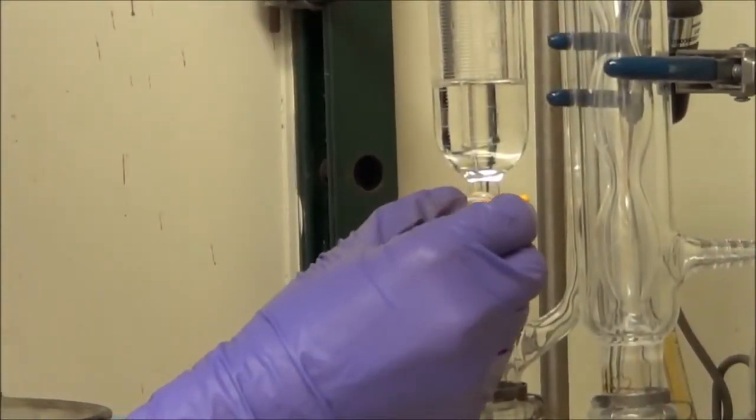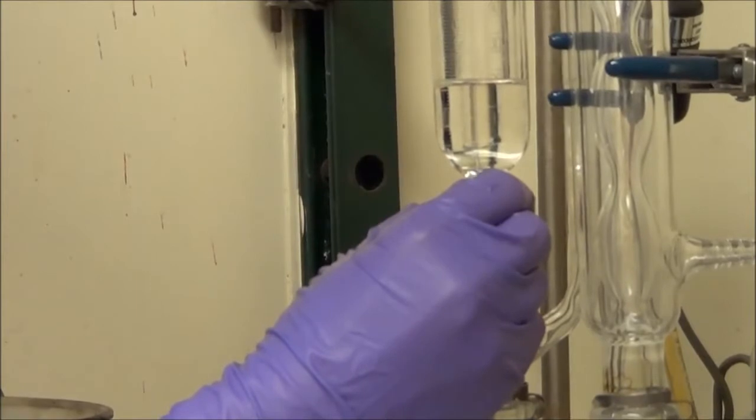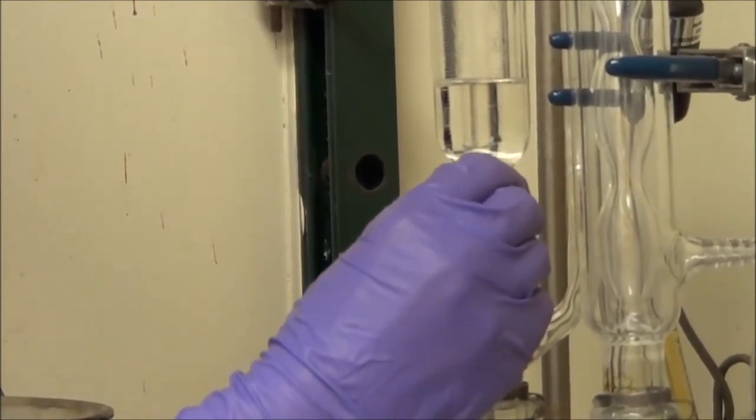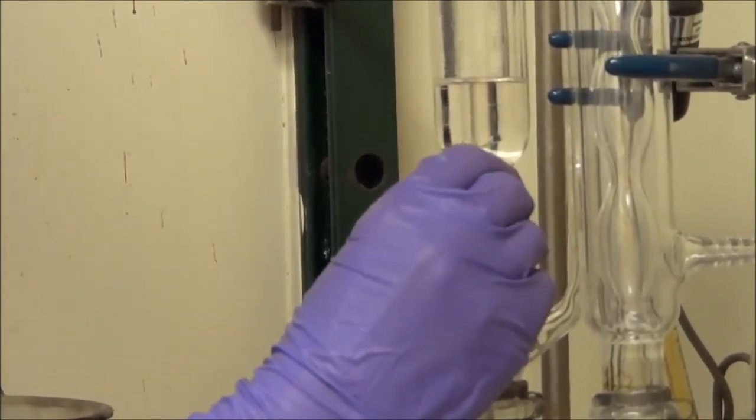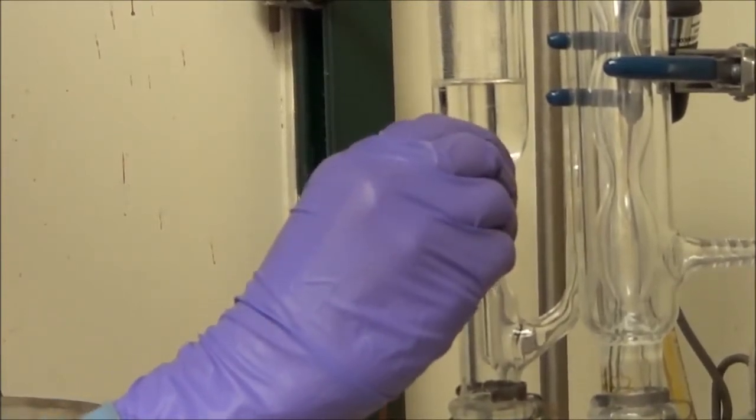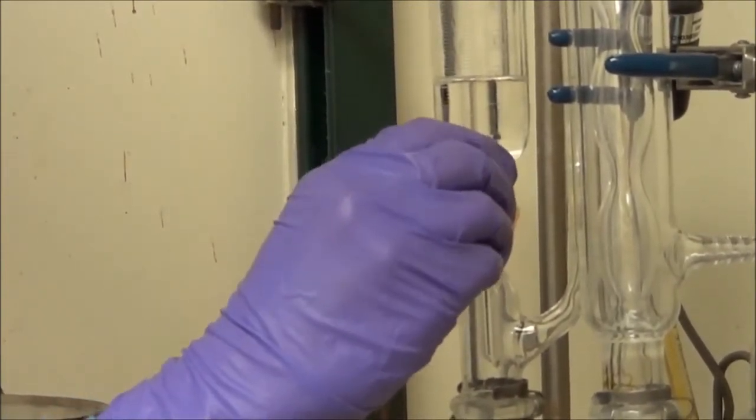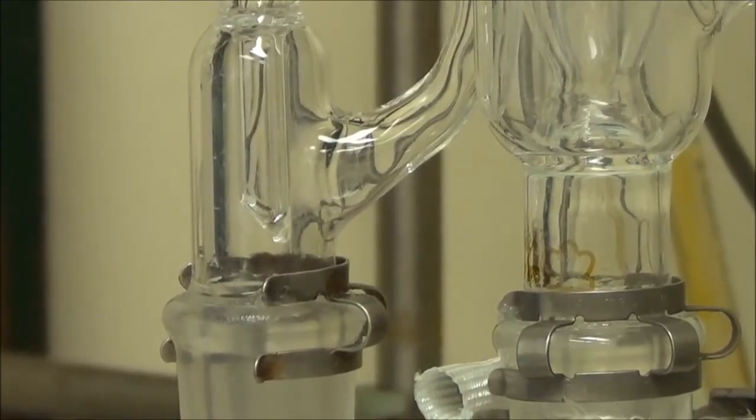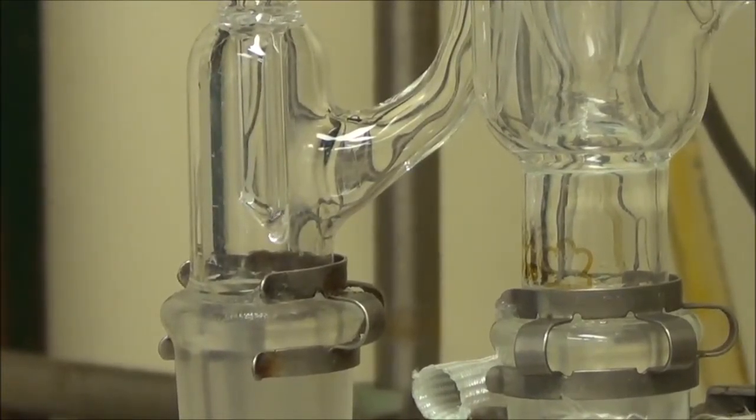Again, slow but sure, keep an eye on it, and the stopcock can sometimes jerk a little bit, and it's just one reason that you have to have experience doing this to get it just right. And again, I'll show you the slow drip, about one drip per second, as the alkyl component drips into the activated dibutyl phosphite.